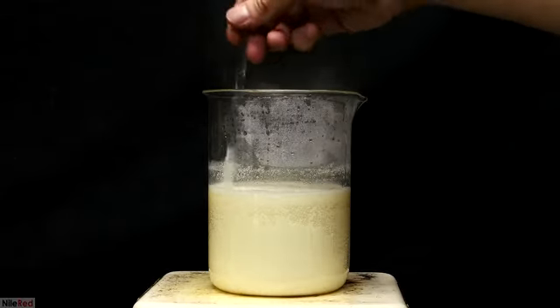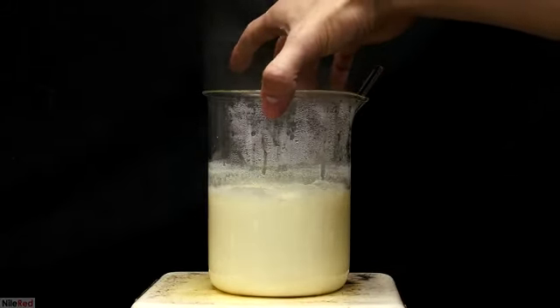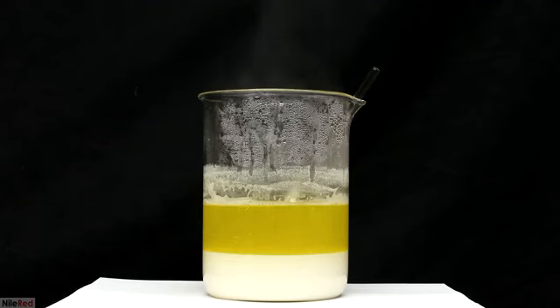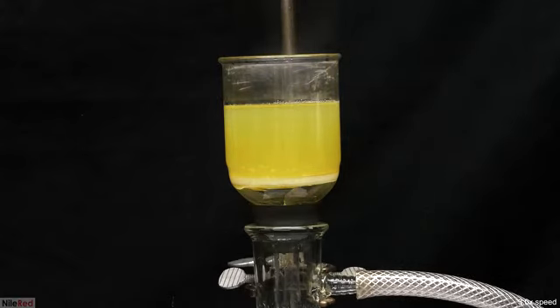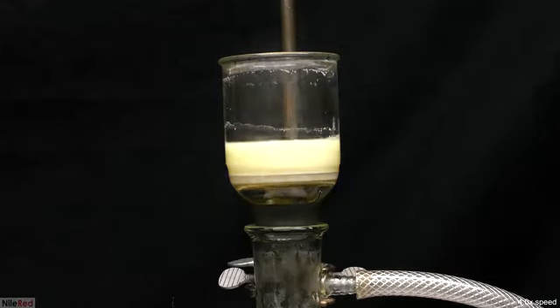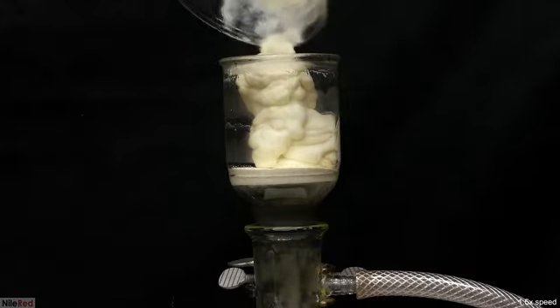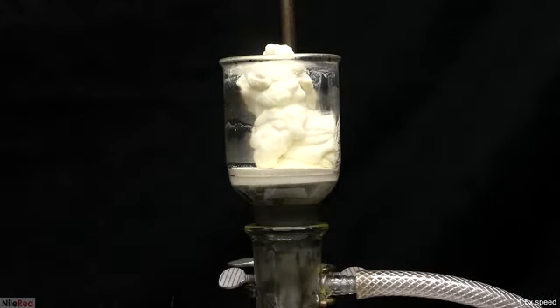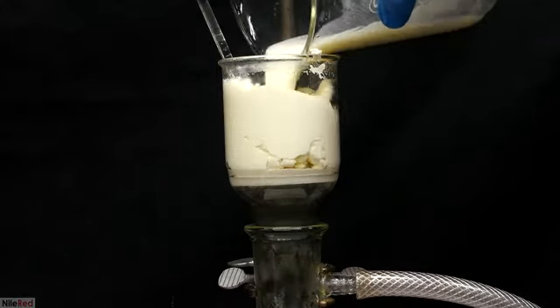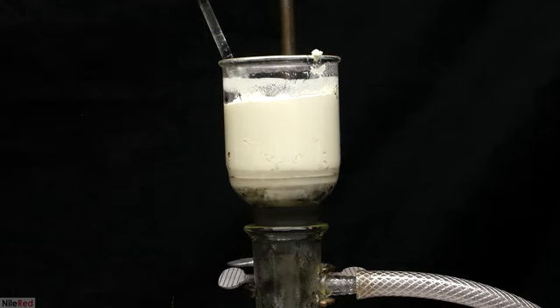Eventually it started boiling, and I stirred it like this for a few minutes. It was then taken off the heat, and the calcium citrate very quickly started to settle at the bottom. While still hot, I went ahead and vacuum filtered it off. The first portion that was filtered off was mostly just liquid, and then the calcium citrate was transferred to the filter funnel. A little bit of hot water was used to wash the beaker, and everything was transferred to the filter.